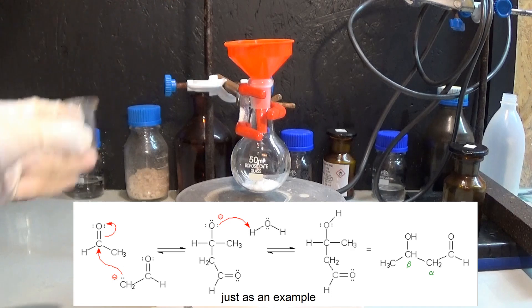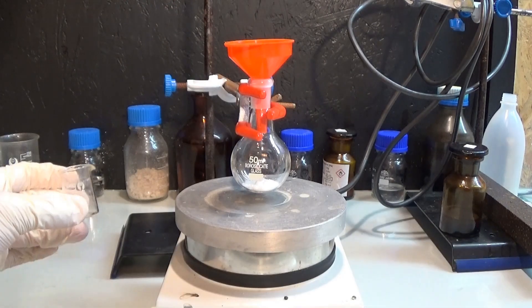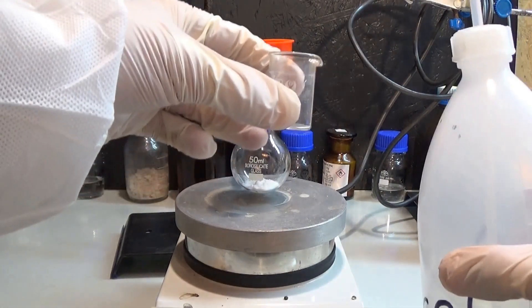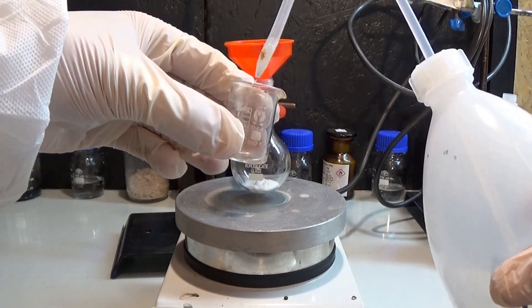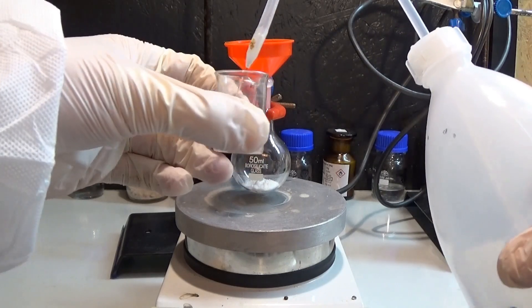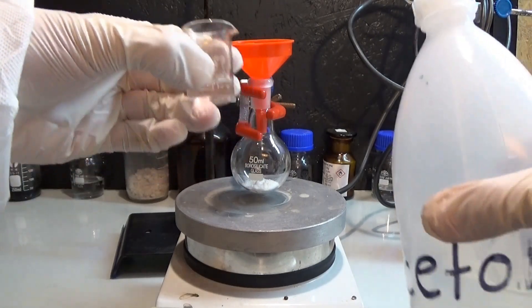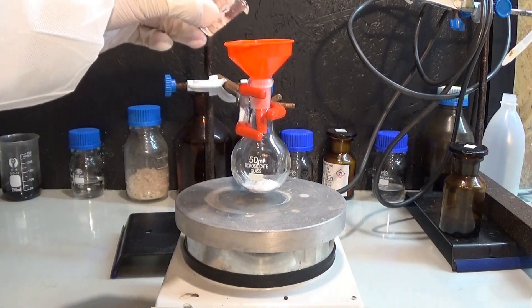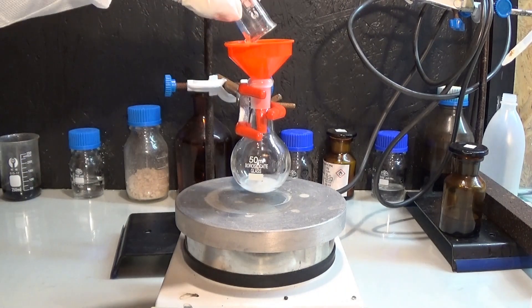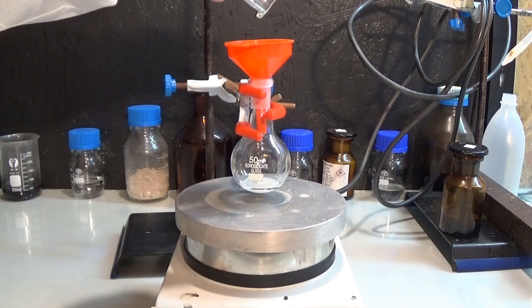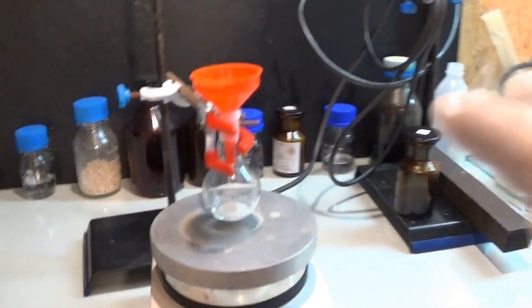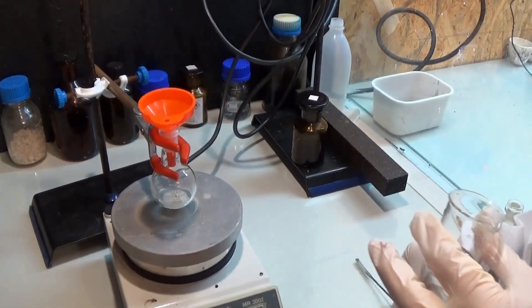The sequence of the reactants doesn't matter. At first I am filling in the bromobenzene and rinsing the beaker once with acetone to maximize the transfer rate. This rinsing step is a normal lab procedure that minimizes the inevitable loss of reactants when they are transferred. This washing with solvent is especially important when you're working with small quantities or a high accuracy is needed.